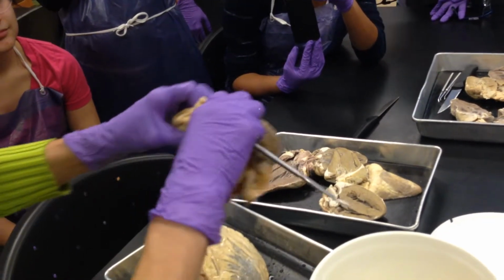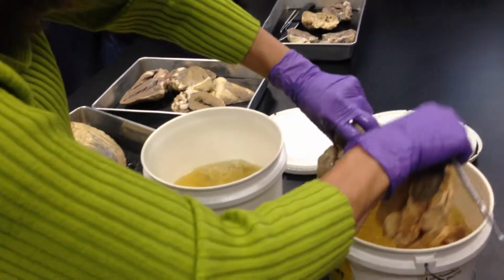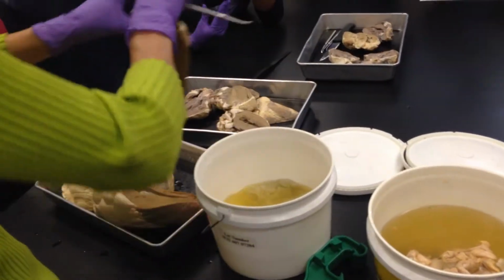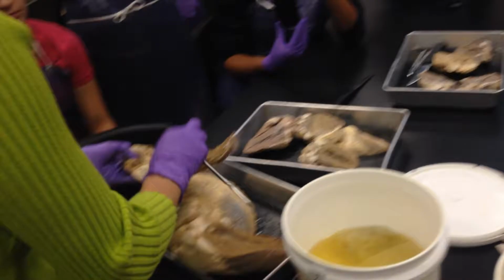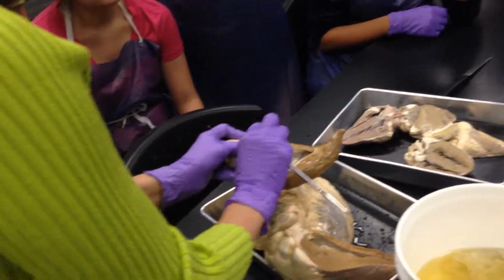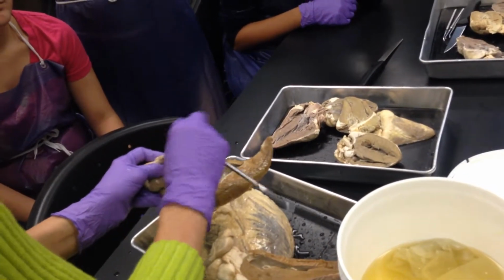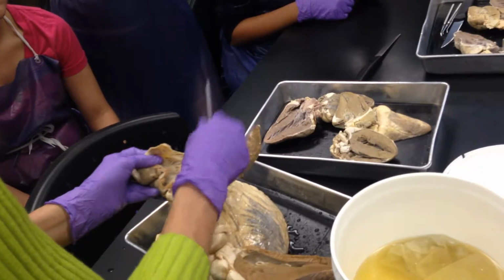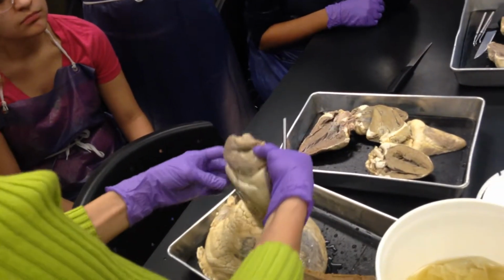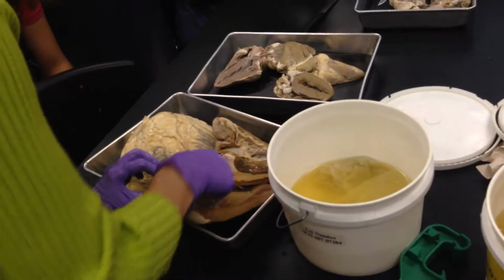Okay. And then over here on this heart, this is more buffalo. Okay. Now you can see nicely the valves. Can you see the cuspid valves right there? This looks like it's the left side, so this must be the bicuspid or mitral valve. And then you can see the cusps of it very nicely on there. And I thought we had a nice semilunar. I guess it was just the aorta.